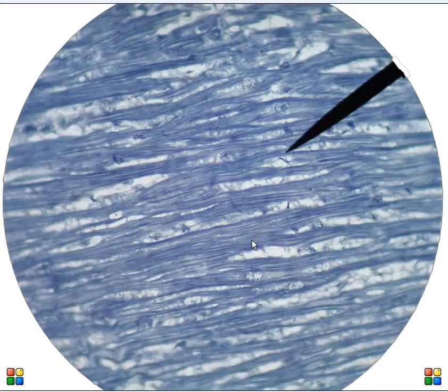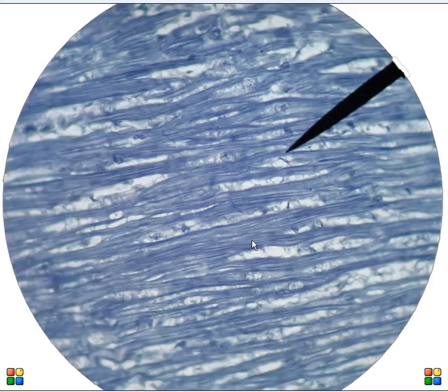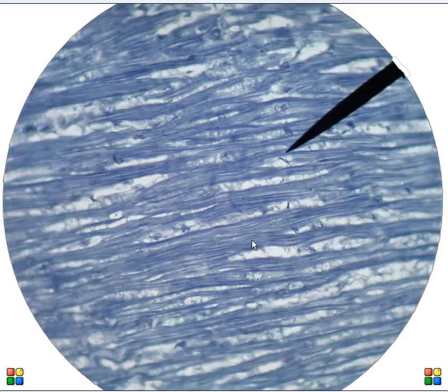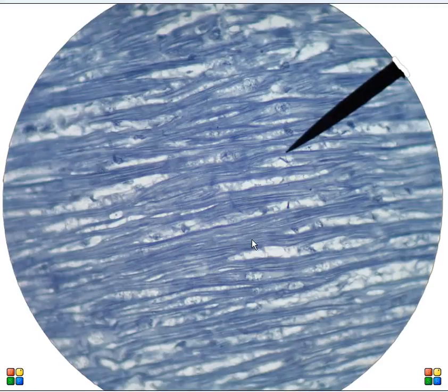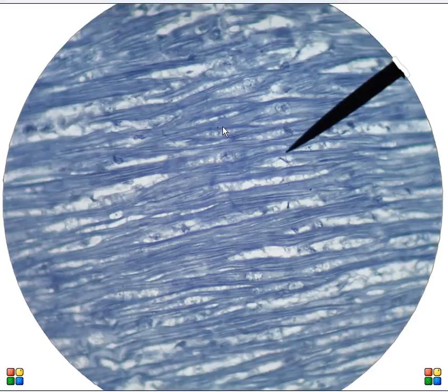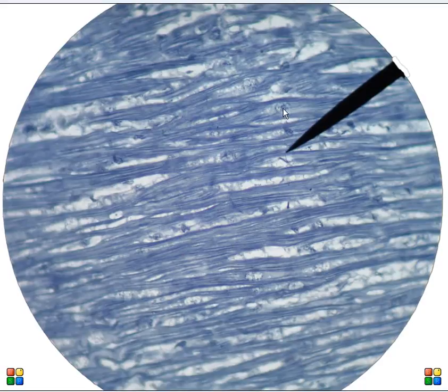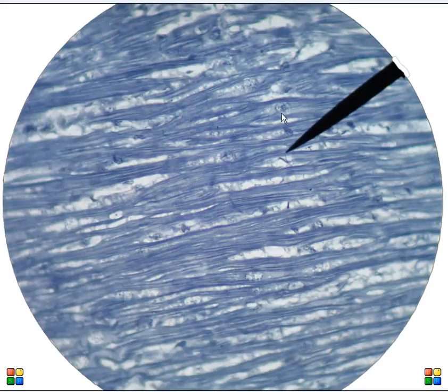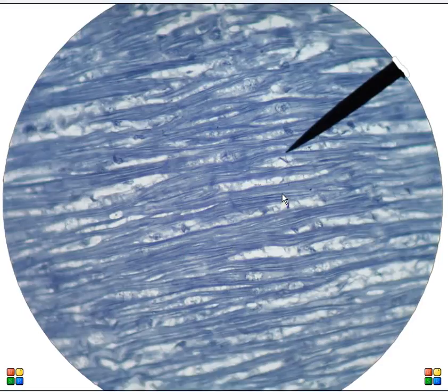The magnification is similar. What you do notice is different here is that this was done using a different staining procedure. All of the major features are still here, but it does look a little bit different in terms of color. You can still see the striations. You can still see that these are tubes of cells that are branched. You can make out nuclei. You can make out the substance around the nuclei.